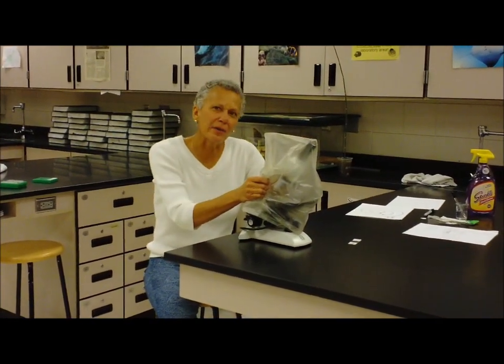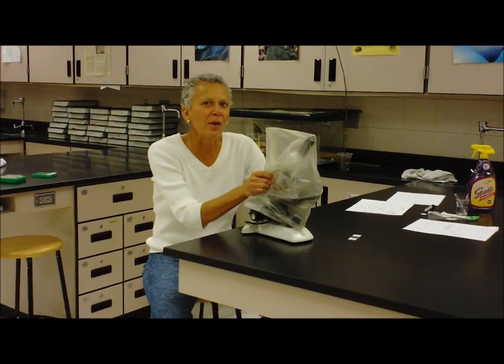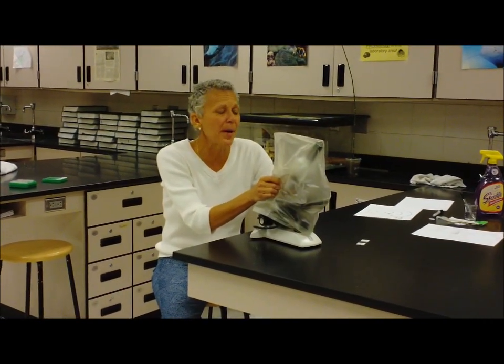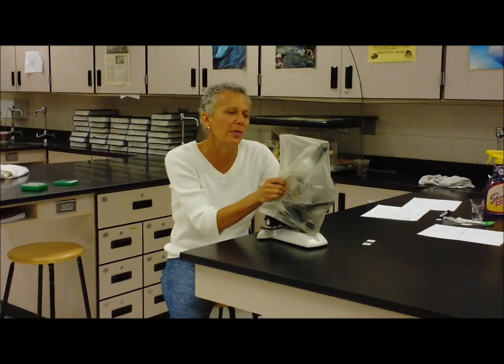Hi, today we're going to learn about how to use a microscope. This is probably a review from seventh grade science maybe, but we want to make sure that everyone is familiar with what they're doing.